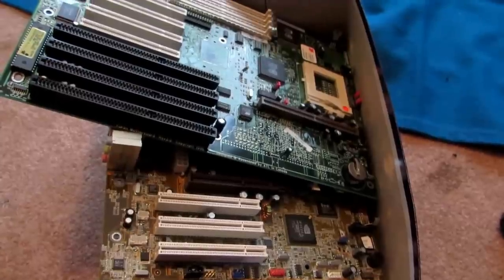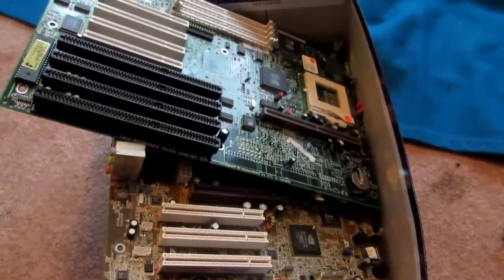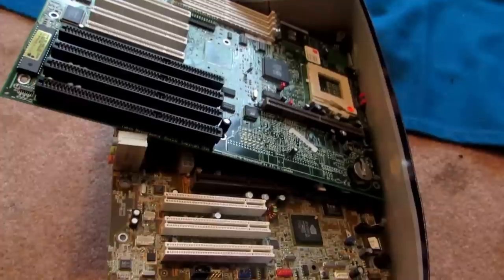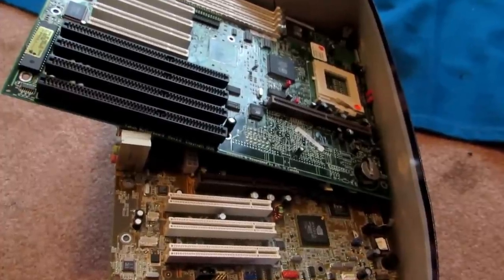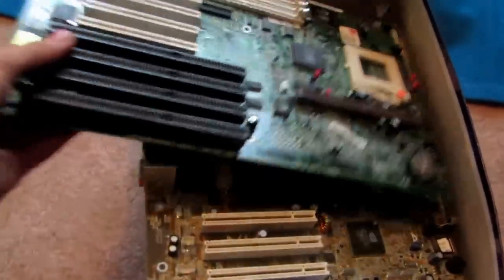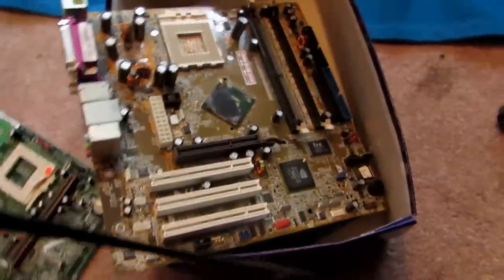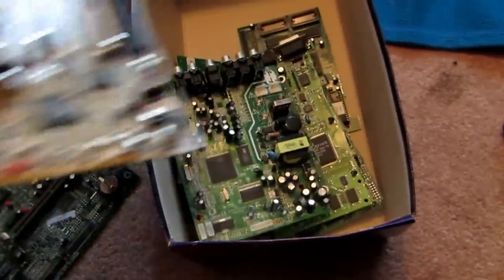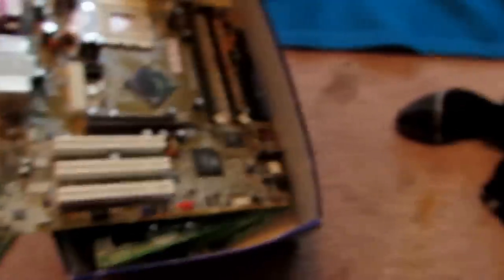Now after I released that video on dismantling a CPU, it seems that you guys would like to see me extract palladium off these circuit boards with these monolithic ceramic capacitors. So I have two motherboards here, and then lots of circuit boards underneath from different various computer components.